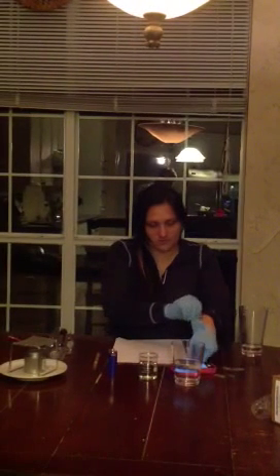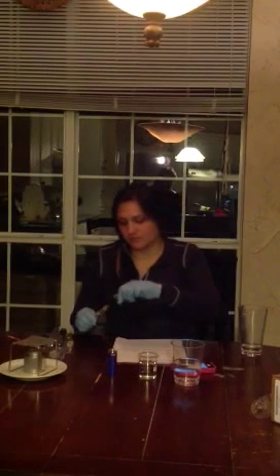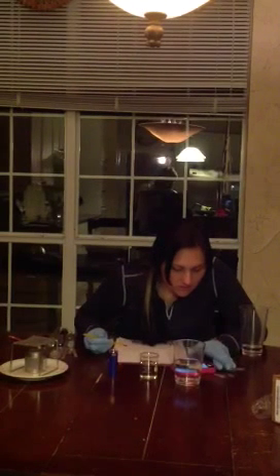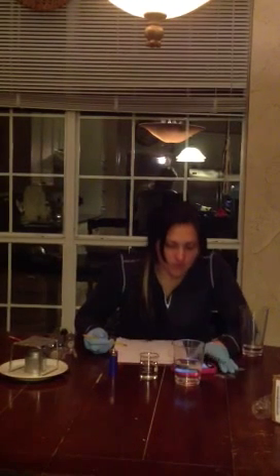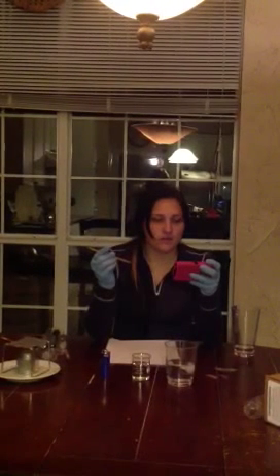So now we're going to measure that temperature. It also says to note that when measuring the temperatures, place the thermometer into the water so that the silver bulb is fully submerged, but not touching any sides of the glass beaker.